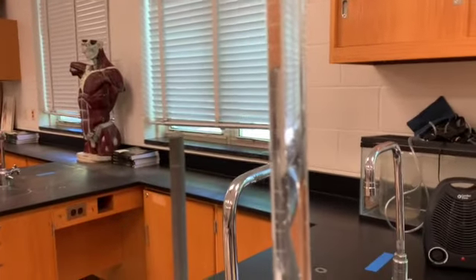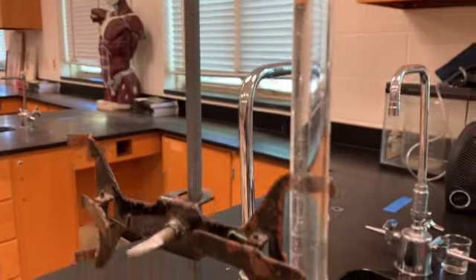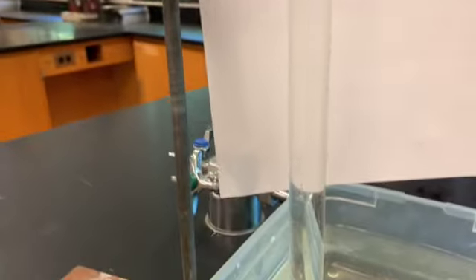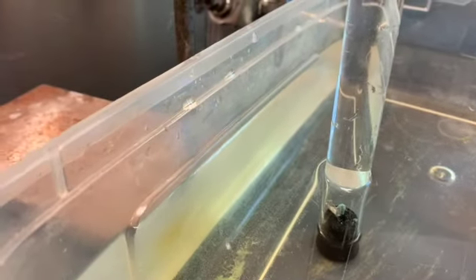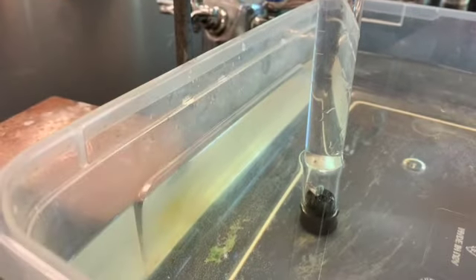Okay, and now you can actually see, hopefully. Why don't you put the white paper up behind? You can see the acid making its way down. Okay. And it's going to touch the magnesium metal, which is there at the bottom. And in a little bit, we are going to see bubbles form. So Maurice, why don't you tell people when you start seeing bubbles form? Oh, there's a few. Okay, there's a few.